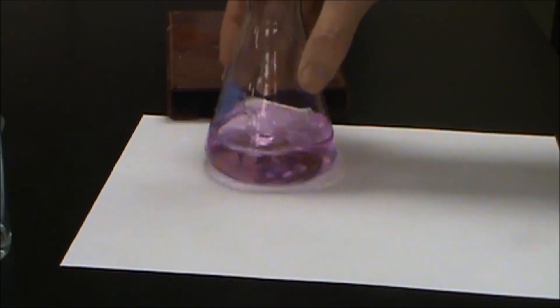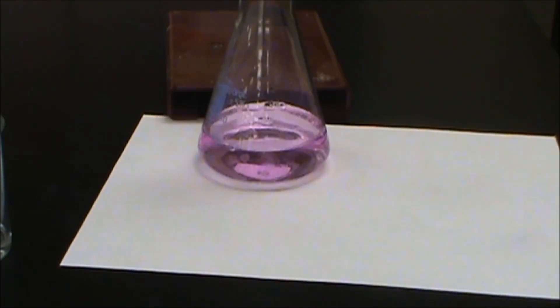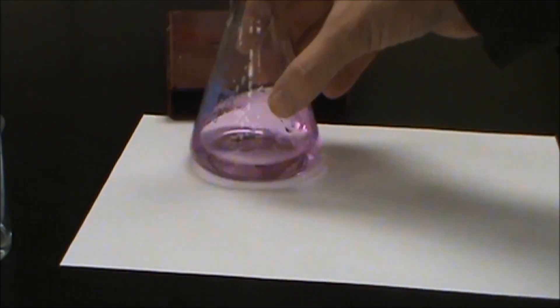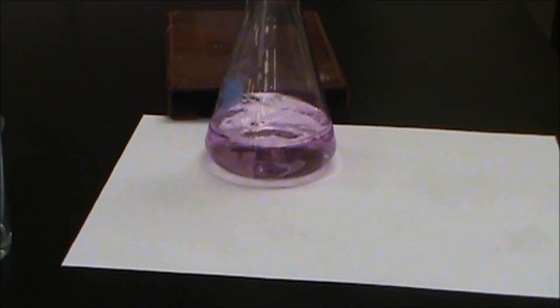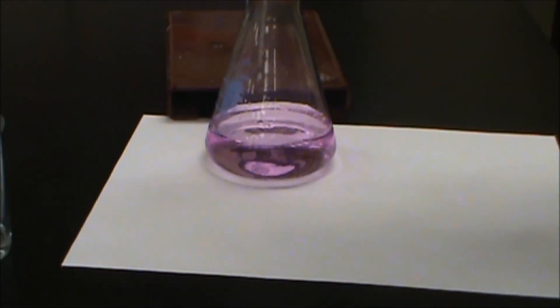It looks like there's our end point. And we're at a volume of 23.15.